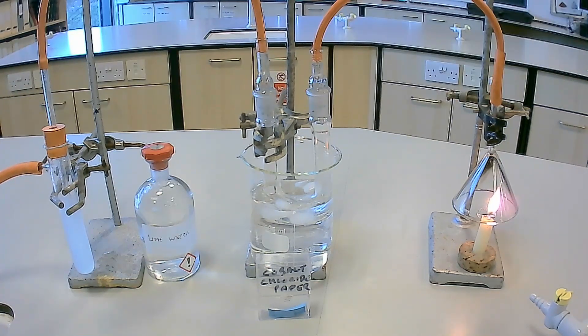The calcium hydroxide in the lime water then reacts with the carbon dioxide in the gases being pulled through the apparatus, forming a white precipitate of calcium carbonate. The equation for this reaction is shown on screen now.